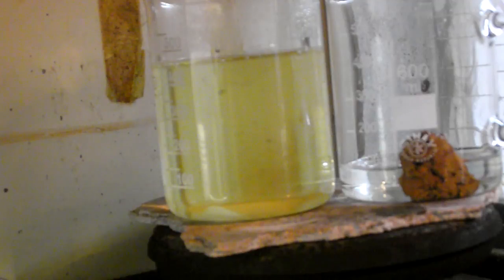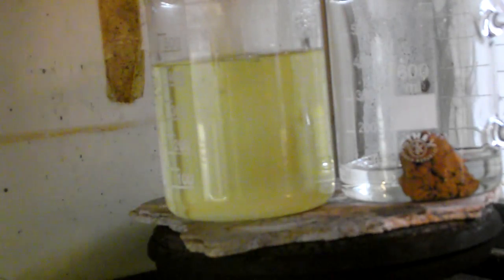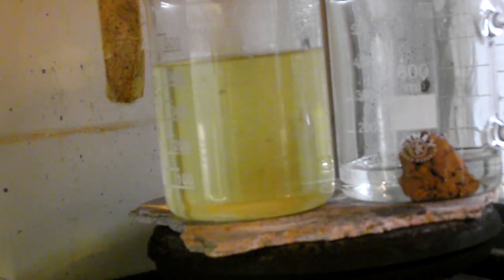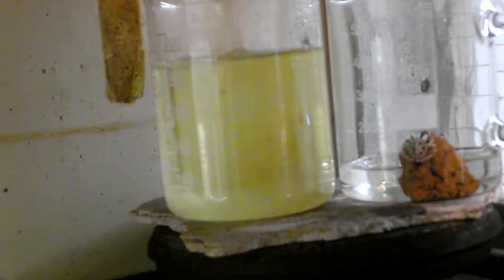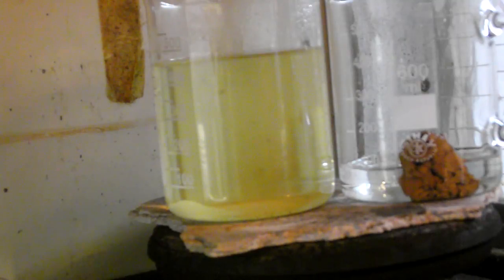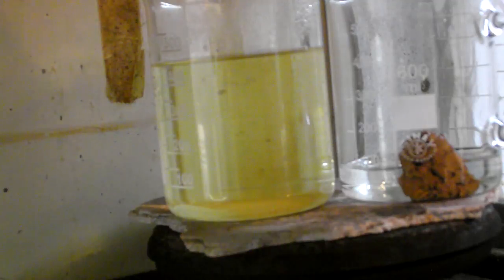I started adding more oxalic acid to the solution in hope that it would lose its yellow color, producing more of the gold sediment. And indeed, some gold clumps did appear.